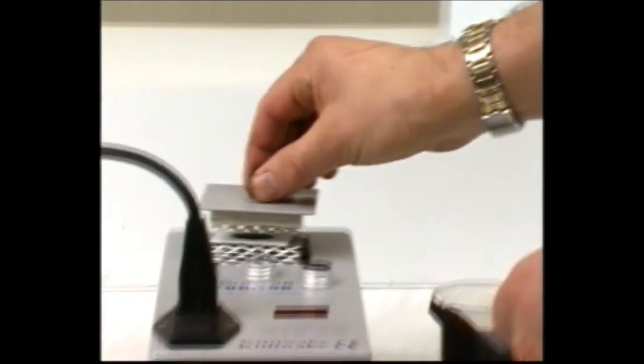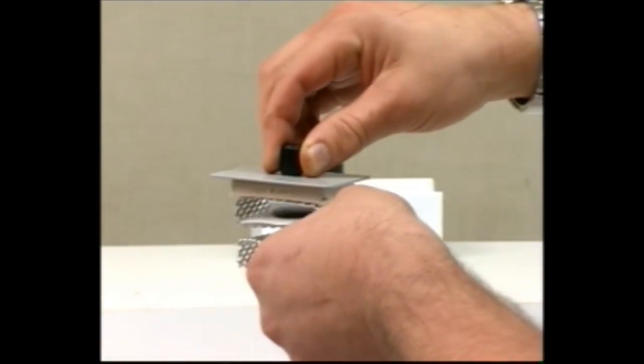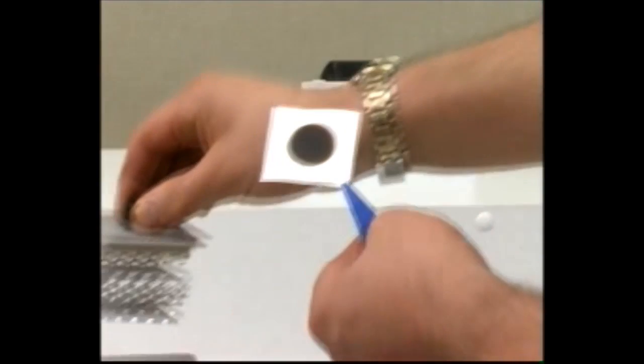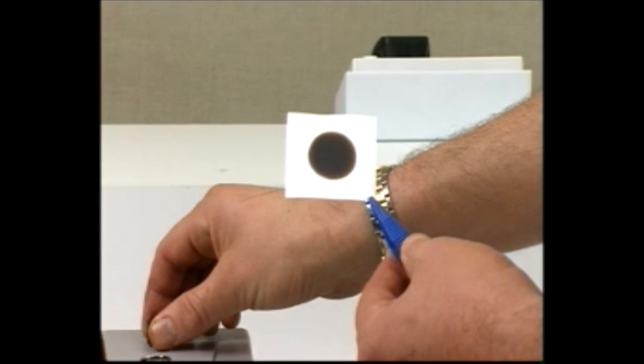Remove the paper and compare it against the spot rating chart in your user manual. Ignore all other characteristics of the spot except the center ring. Any rating other than 1 means that the oil is likely to deposit sludge to some extent.